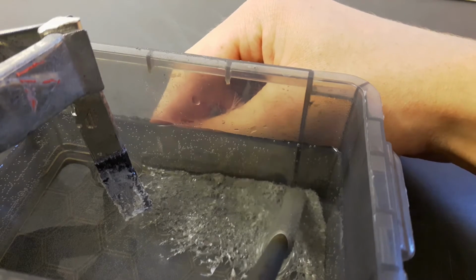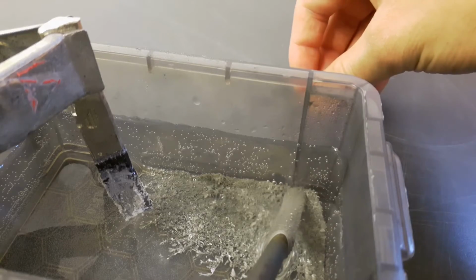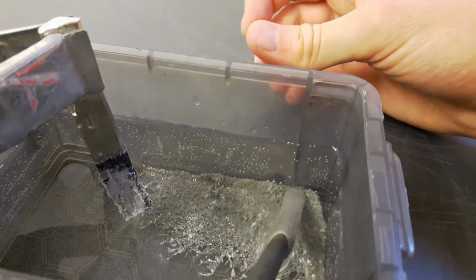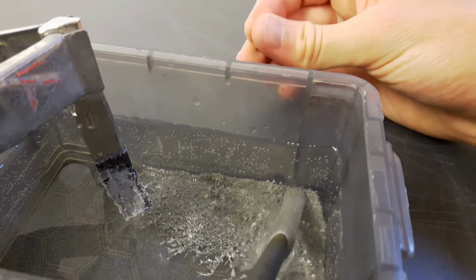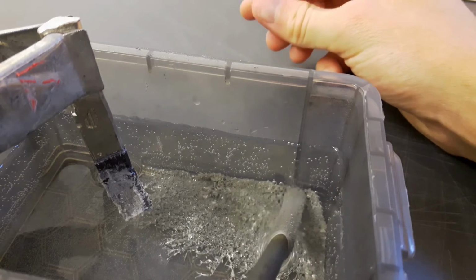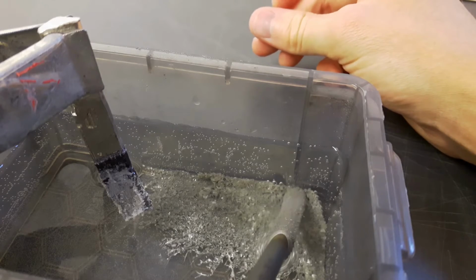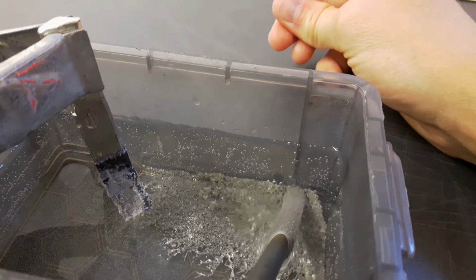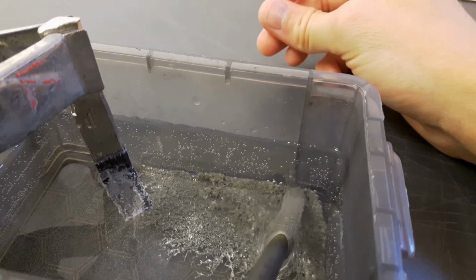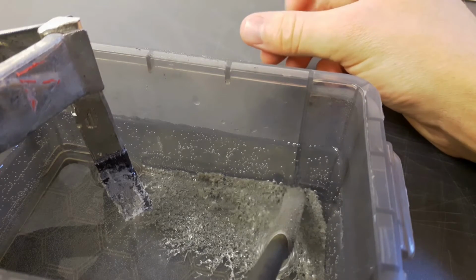Again, 2 minutes later, the tin on the negative electrode already starts to form some ugly crystals. They will grow over time and I'll show them later. It seems as tin crystals are growing at the bottom of the electrolysis box, and actually my eyes start to tear and I start to have breathing problems. I think that's because of small quantities of hydrogen chloride that are released.